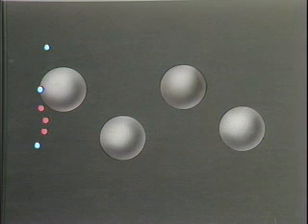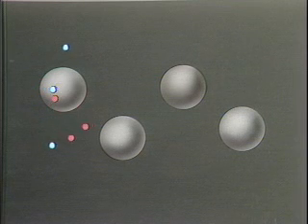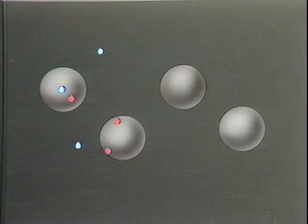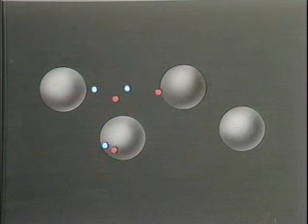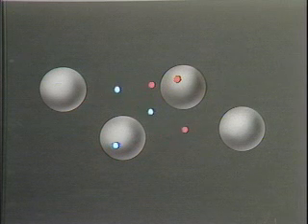In this animated sequence, the blue molecules that are strongly adsorbed by the stationary phase spend much more time in the stationary phase than in the vapor phase, and thus move slowly through the column. The red molecules, which are only weakly adsorbed by the stationary phase, spend more time in the vapor phase and are moved more quickly through the column.